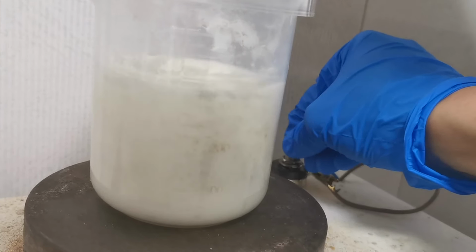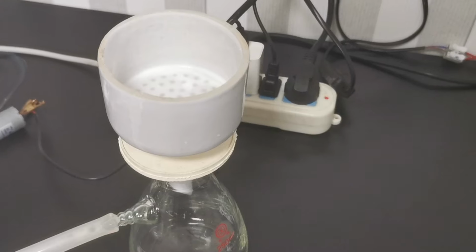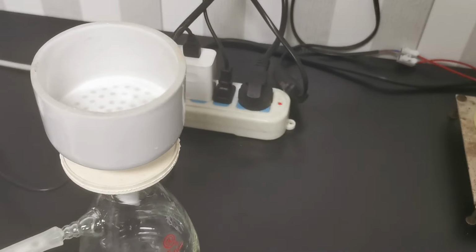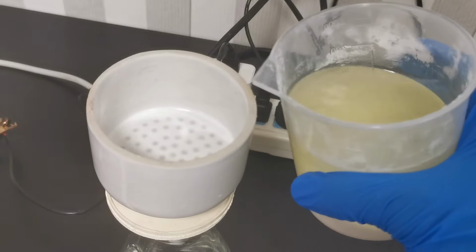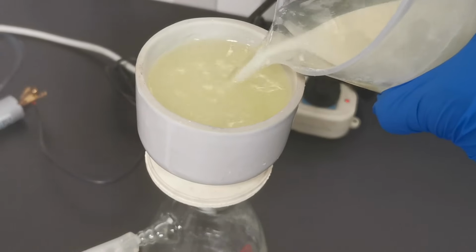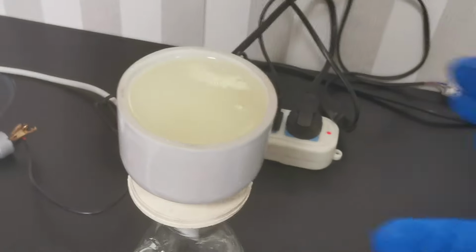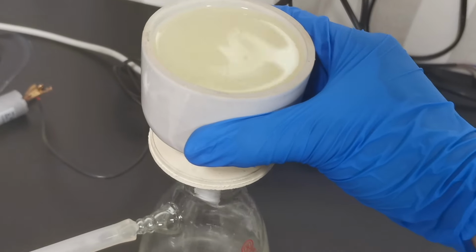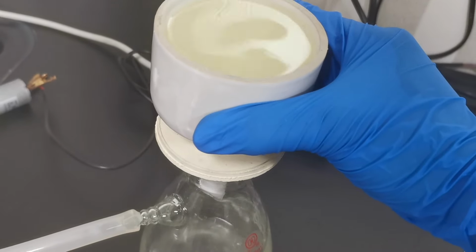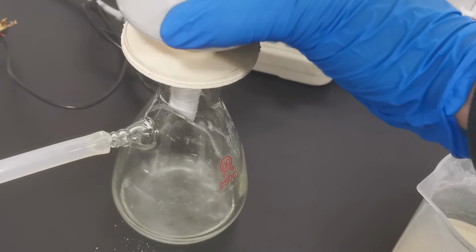It is very important to put some sort of cap on the beaker to limit the evaporation of the solvent. 10 minutes after, I suction filtered the mixture. I initially used a piece of dry filter paper, and everything just passed straight through the funnel because the solvent did not soak into the paper. So I just had to wet the paper with a little bit of water, which lowers the yield slightly as TCCA reacts with it. You can also see that the filtrate is slightly cloudy due to the cyanuric acid formed as TCCA reacted with the water.